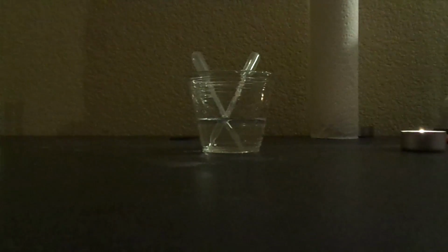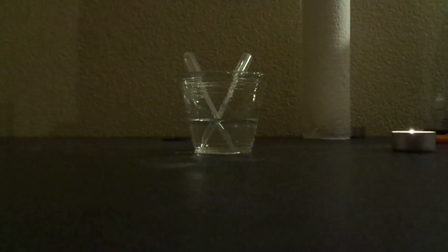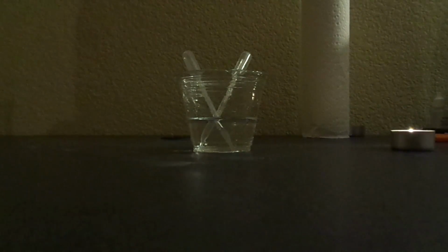And we're going to inoculate it with the S. cerevisiae and S. epidermidis that we've been culturing, and we're going to see if these two microbes can grow in these two different environments. Okay, so I'm going to go ahead and demonstrate. We're going to be using aseptic techniques to do a pure culture of this, so we know that it's that microbe that we're testing.